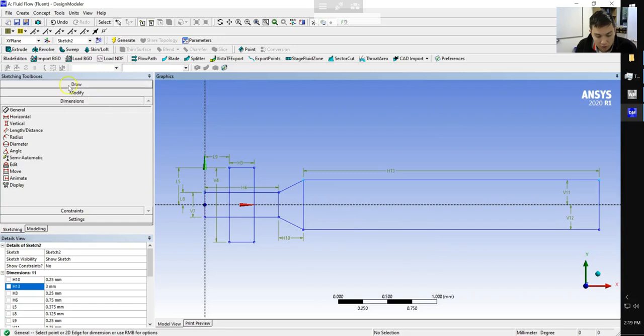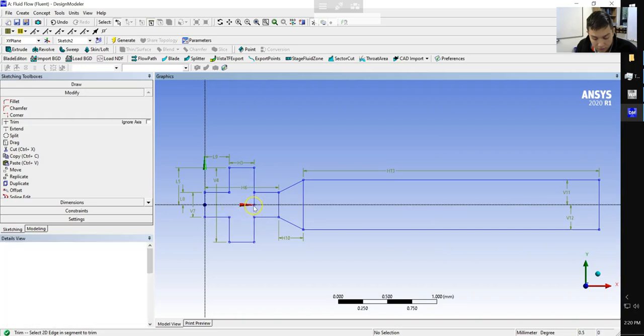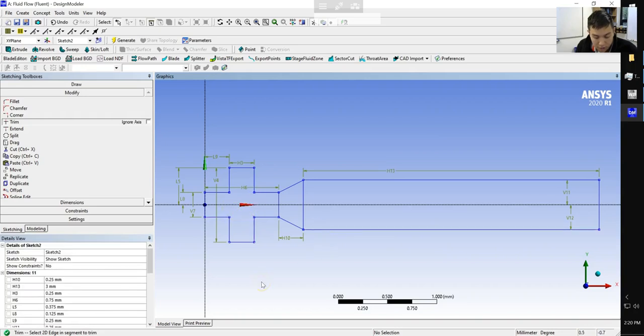So we're going to use the modify function. Right above where we set our dimensions, there are a number of modifications that we can make. The one we're going to be using is trim, which allows us to eliminate some of the edges in our domain. We can click on a particular edge, and be careful where you click on it. The segment that you're clicking on is what will be deleted. I've got my cursor selected in the middle of this, and you can see I've removed that edge. Same thing here. Notice that it does stop at the x-axis, so you're going to have to click on that region twice. So we've eliminated everything so far.